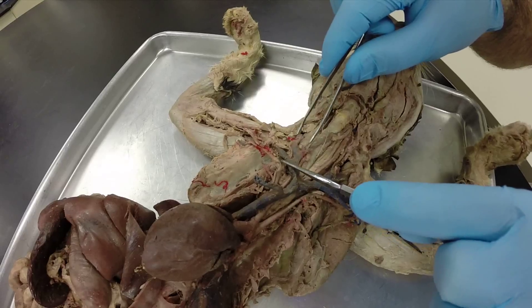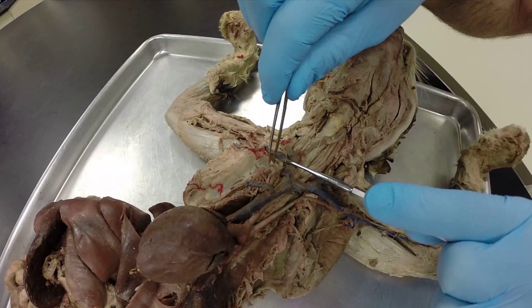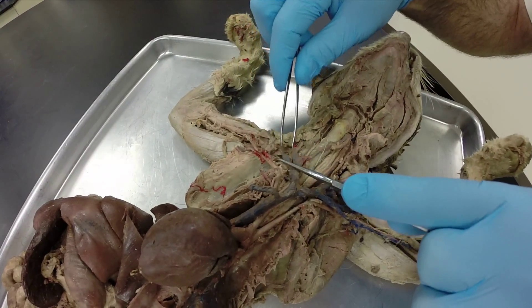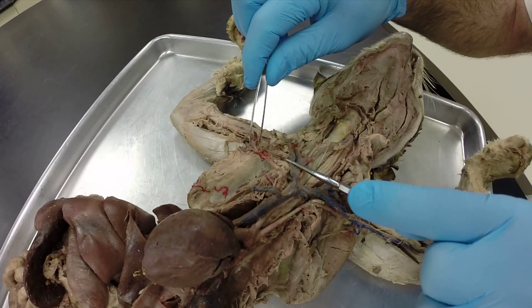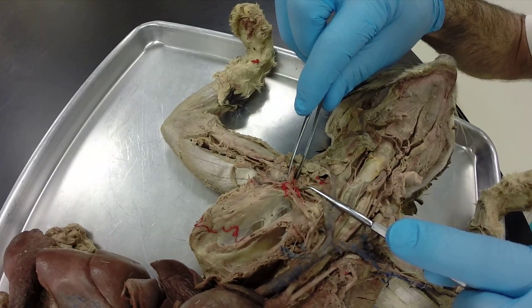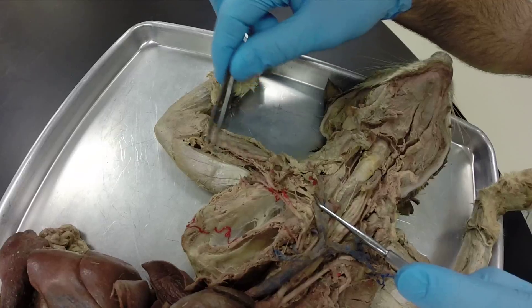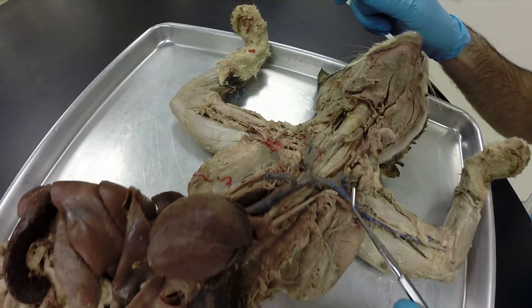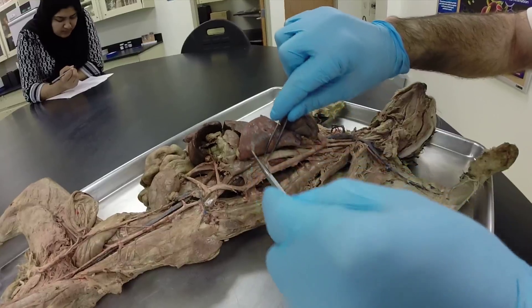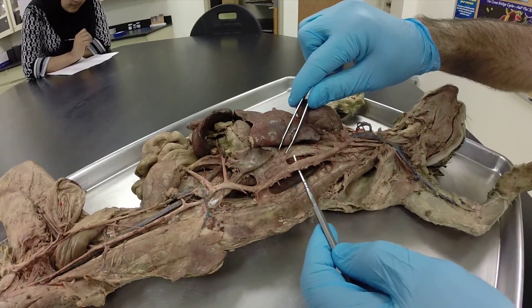Just like on the left side, the right subclavian is going to travel out into the axillary region where we call it the right axillary artery. The right subscapular is going to branch off, and then it's going to continue out across the arm where we call it the right brachial artery.